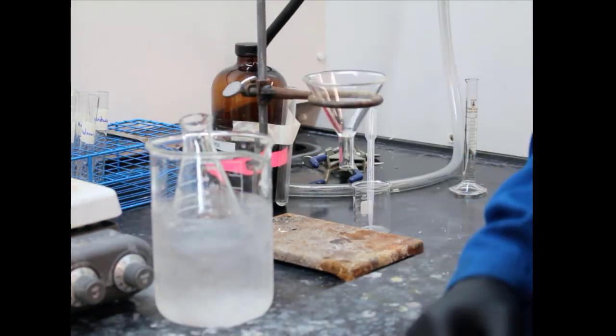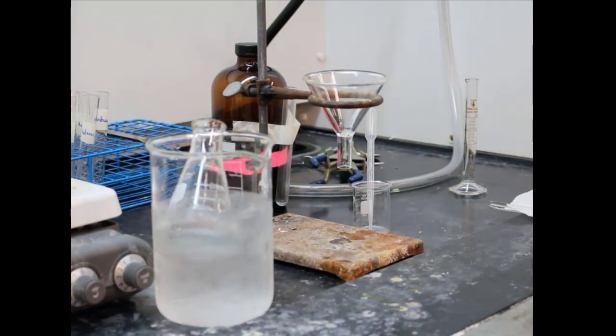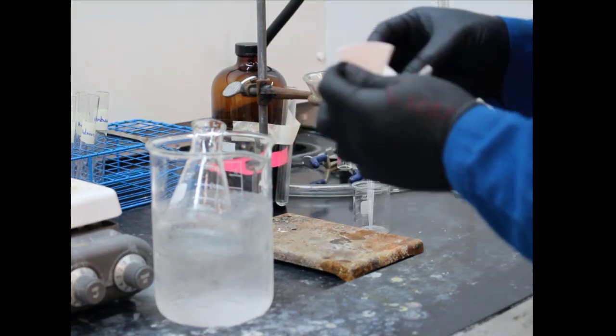Ooh, y'all. All right, so we're in the process of cooling down. Whoa, y'all. Hey, y'all see that? The Erlenmeyer flask moved. I think that fume hood's haunted.